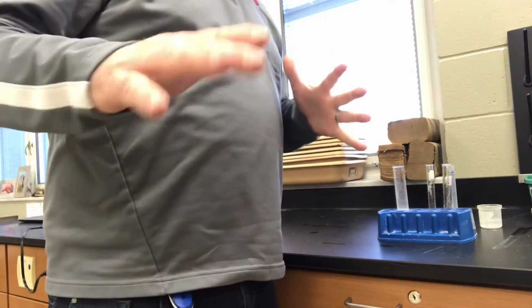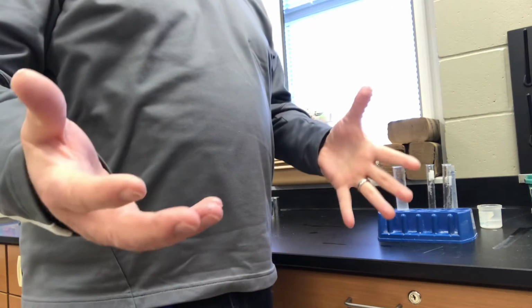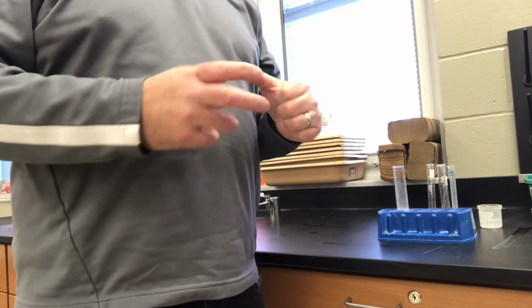Okay guys, we're back, and like we said, in the initial reaction you saw, and could hear, evidence of a chemical reaction, but that's not what a precipitate is. A precipitate is a solid that is formed out of solution. Remember, what we originally started with were liquids. The baking soda and the calcium chloride were dissolved into those liquids, so you couldn't see them. There was no powder in there.